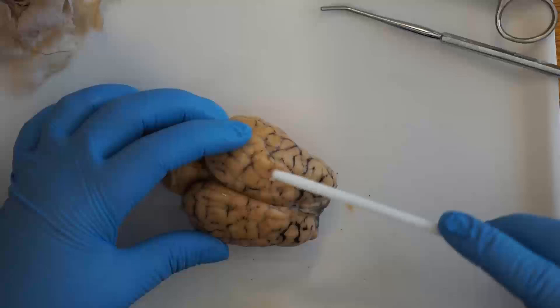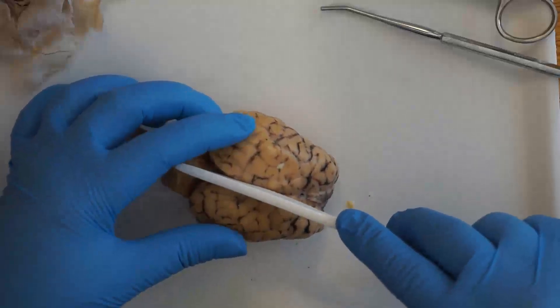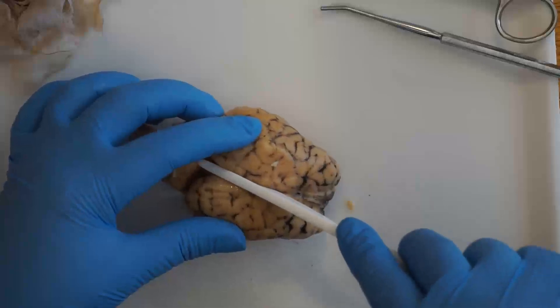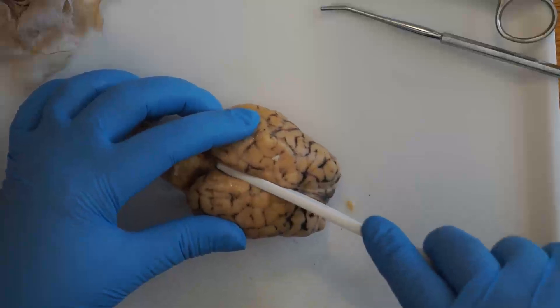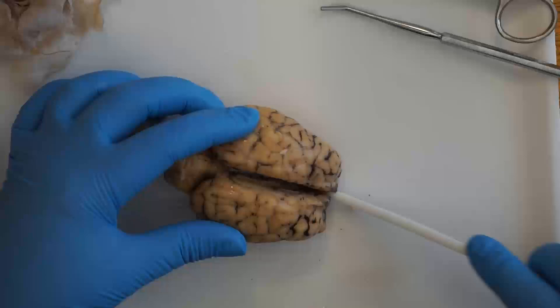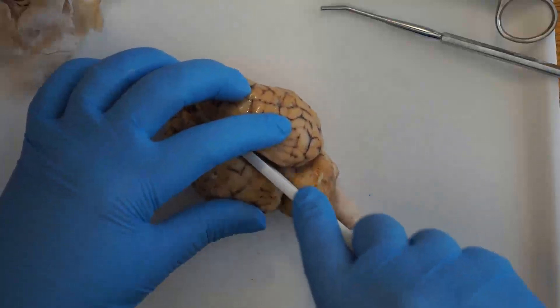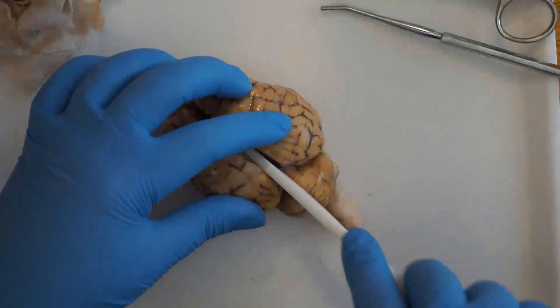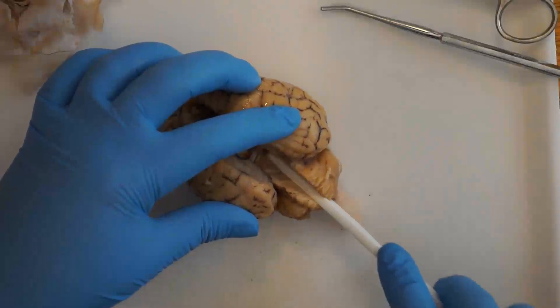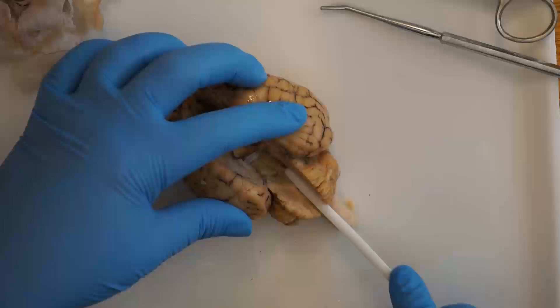The next thing I'm going to do is divide the brain in half down the longitudinal fissure so that we can look at some of the internal features of the brain. I'm using a plastic knife just because the brain is very soft, but if you'd rather use your scalpel or scissors, that's fine too.